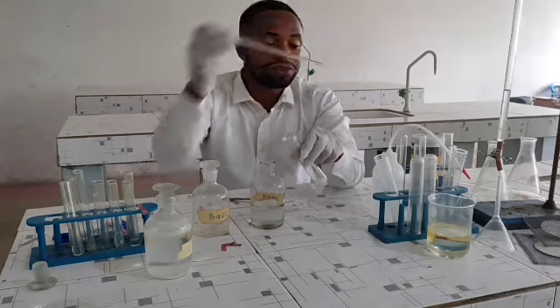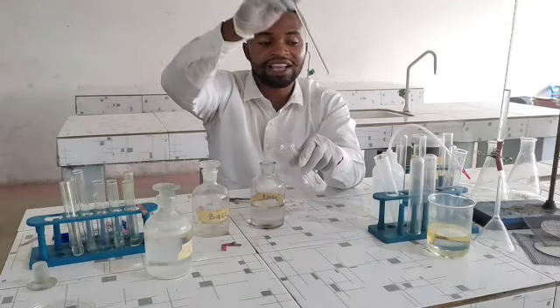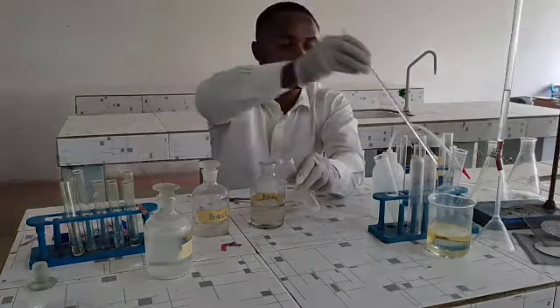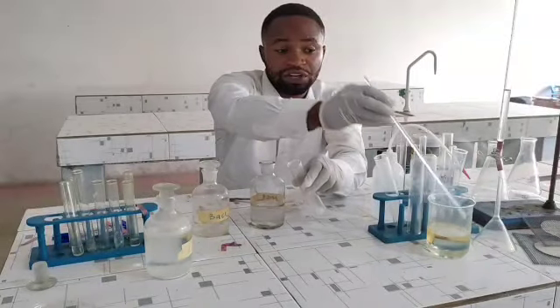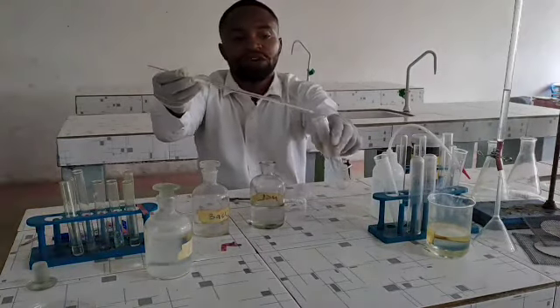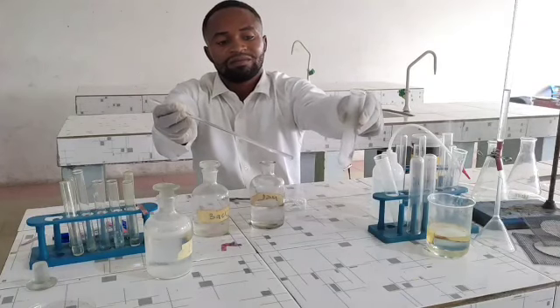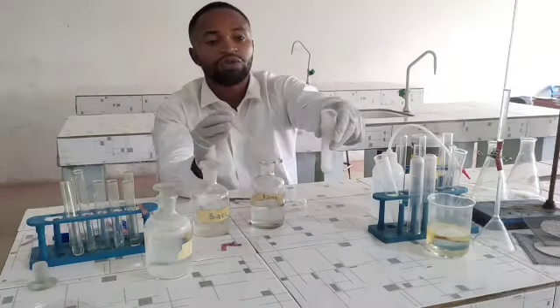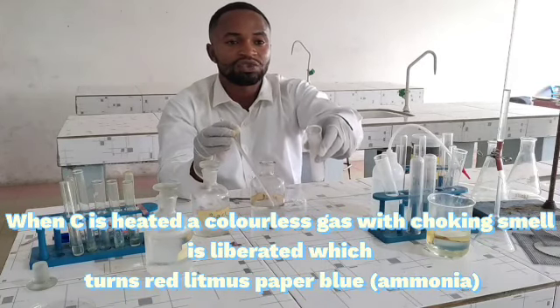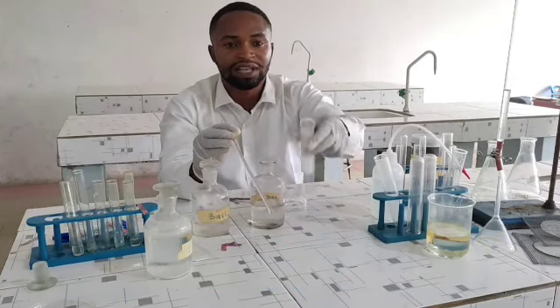And for you to confirm that truly, if you test it with concentrated hydrochloric acid, dense white fumes of ammonium chloride will form. Please take a look. I have not heated, but even without heating, take a look at this. You see the dense white fumes? These are dense white fumes of what? Ammonium chloride being formed. So the gas actually has a choking smell. That gas is ammonia.